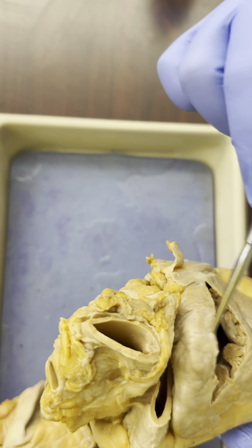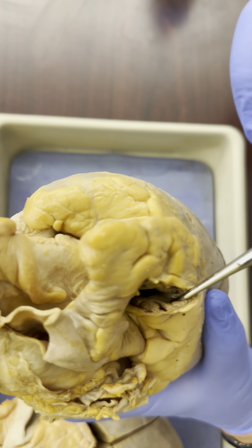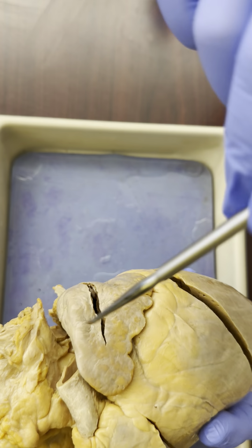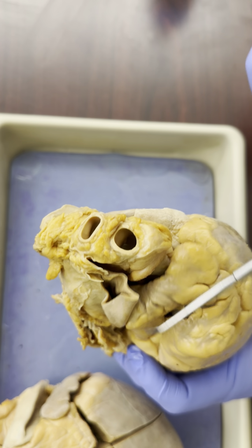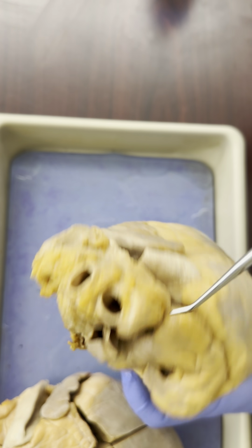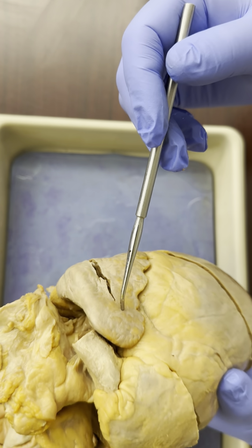So if I open this auricle up, you can see that it is hollow. And on the other side, this auricle, if I open it up, you can see that it is hollow. Well, the auricles are where the atria are found. So here, if you were to be asked, what chamber is this? You would say this is the left atrium, and this is the right atrium. The right auricle houses the right atrium. The left auricle houses the left atrium. So that's two things that you could be asked right away.